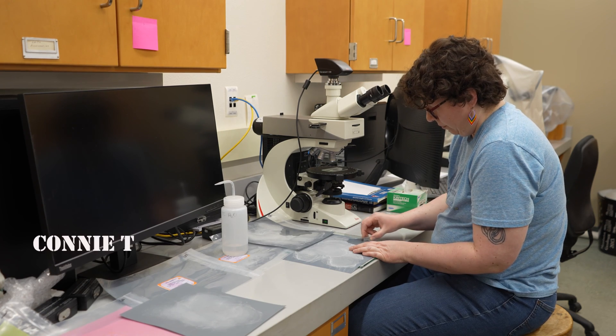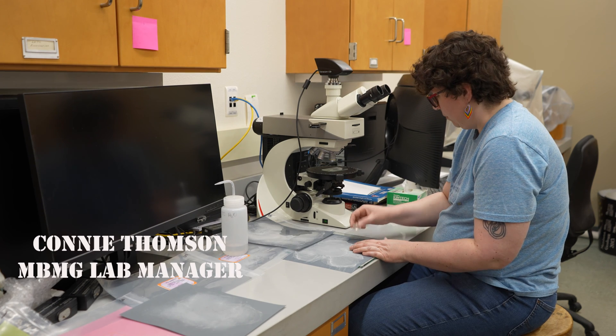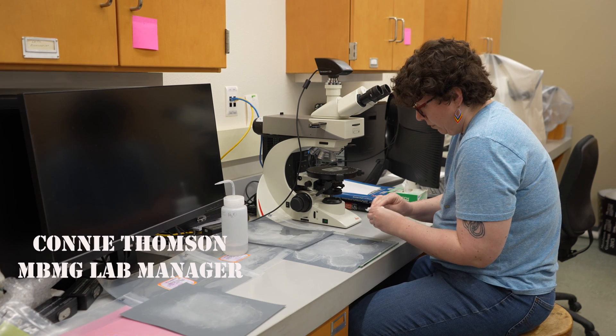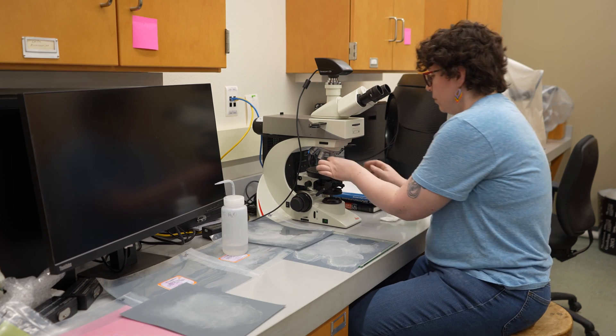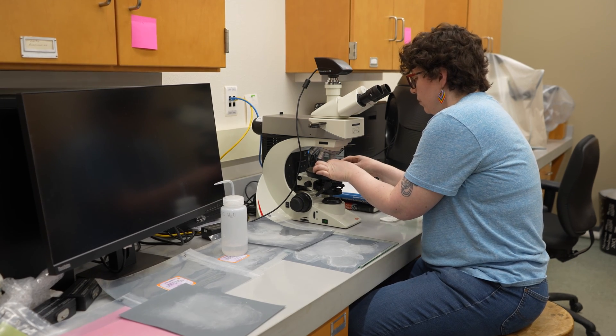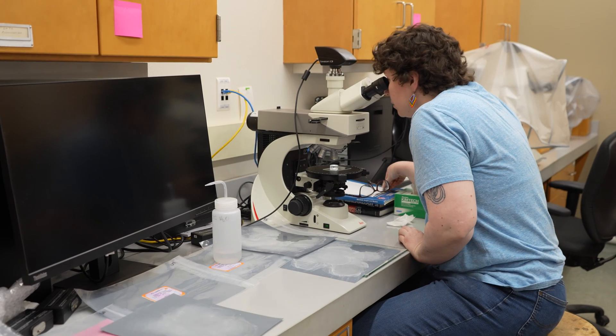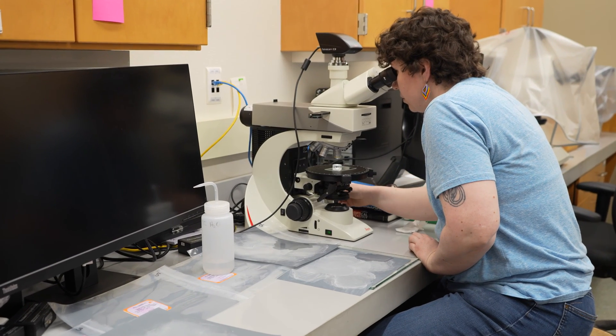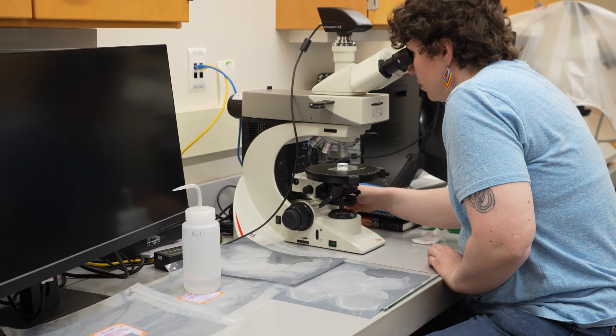Our final step before analysis is to mount our zircon grains in epoxy and polish them to expose our hard-earned grains. This process happens in five stages, working from a coarse to finer abrasive. The final polish is checked for perfection under the microscope.